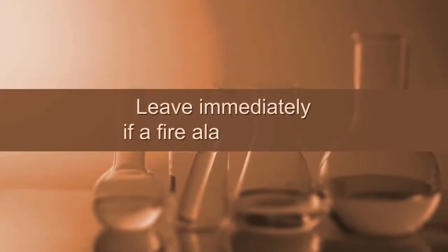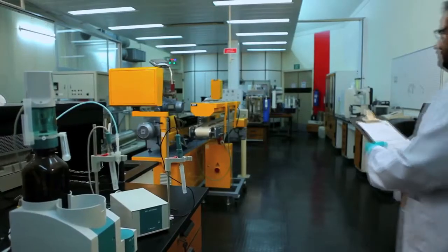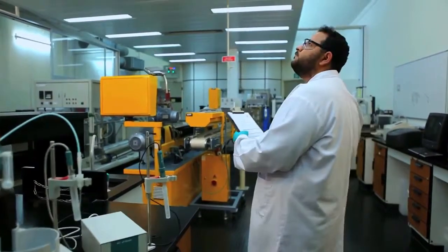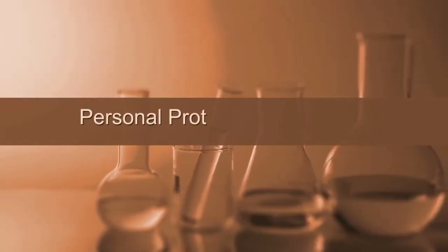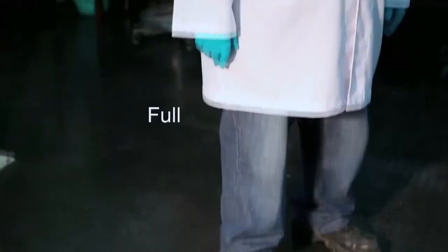It is imperative to leave the building immediately when the fire alarm sounds. In addition to recognising hazards and evaluating your laboratory, you must take steps to protect yourself. Personal protective equipment, often known as PPE, is key to ensuring your personal safety.